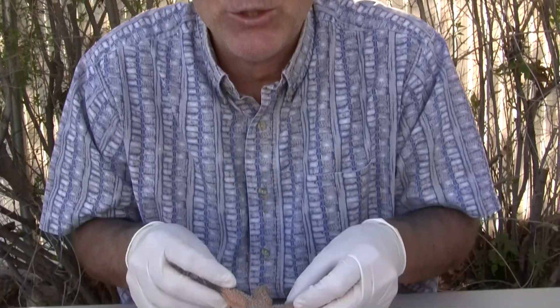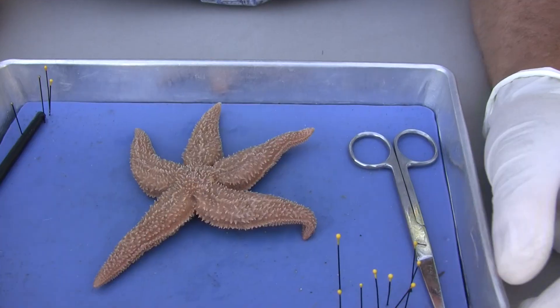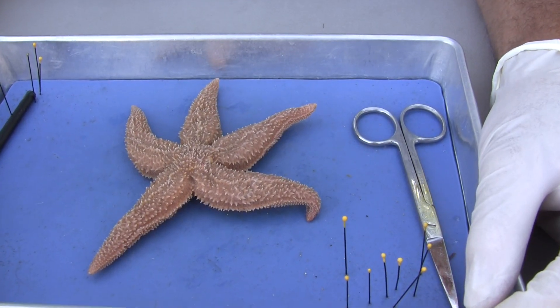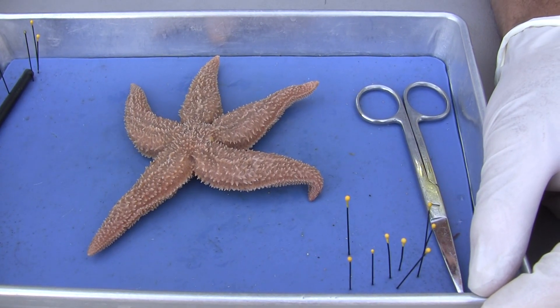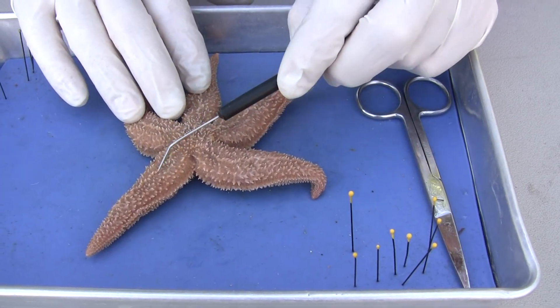Hello. Today we're going to dissect an echinoderm. We're dissecting an echinoderm — it's in a completely different phyla. We just finished up looking at two arthropods, a crustacea and an insect. So this is an echinoderm, means spiny skin, and you can see the spiny skin there.